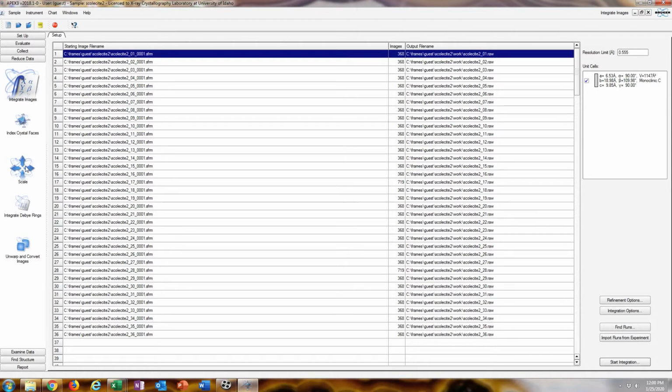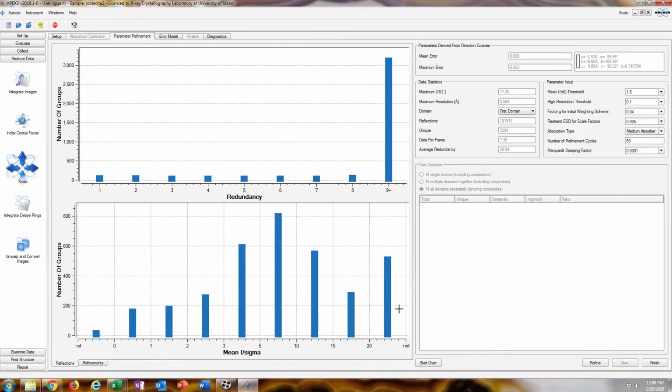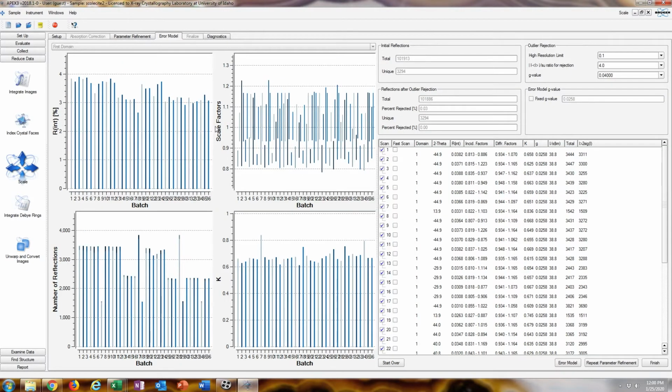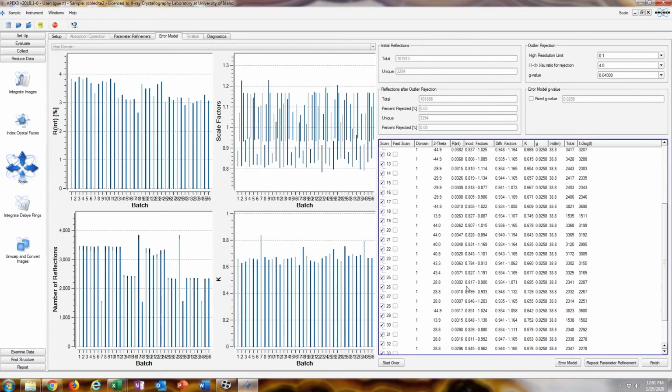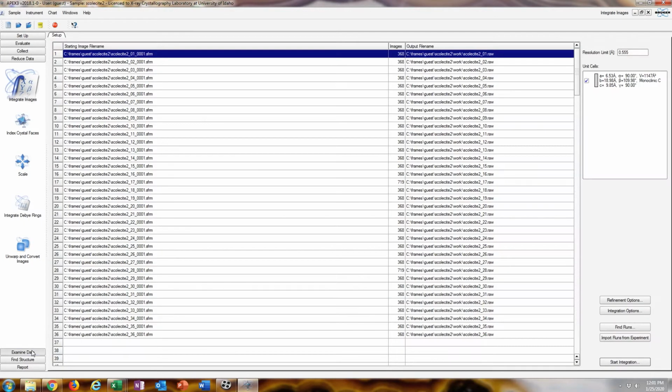So now you're going to scale the data, make sure these are all operating on the same world here. As monoclinic, the Laue group should be 2/m. Start. Just going to enter this as a medium absorber, and then click refine. And this converges on a reasonable R. And the R internal statistics, that's our scale factor. Our R internals are pretty low, which is good. We have good consistency among symmetrically equivalent spots overall. So yeah, that's pretty much scaling.